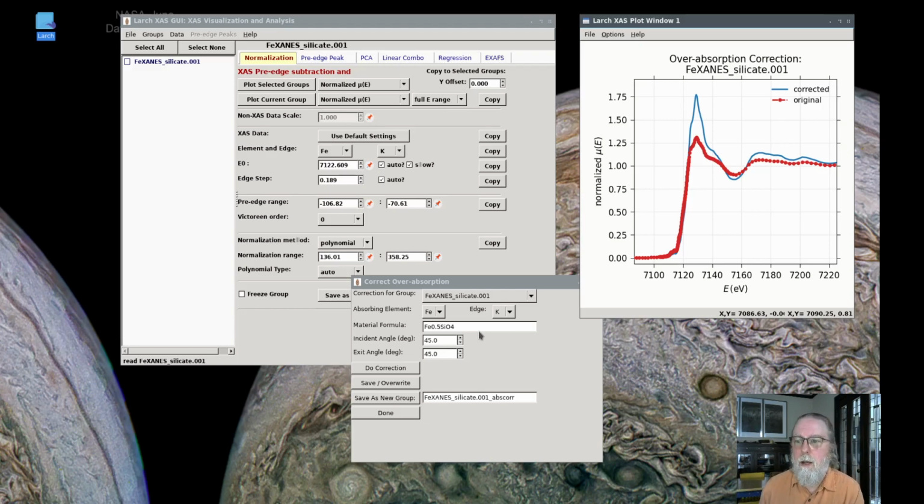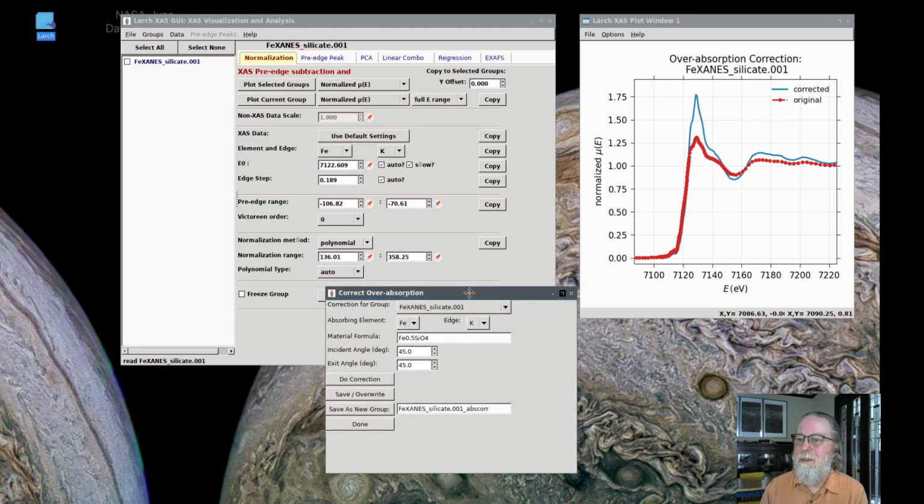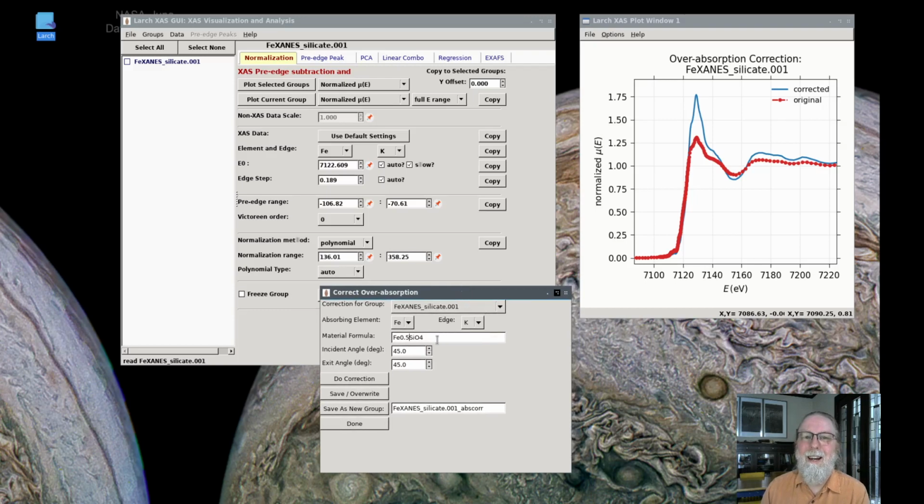For XAFS data, they will give a systematic error in the Debye-Waller factors that you analyze. So if you're doing extended XAFS analysis and want the Debye-Waller factors to be accurate, then you'll need to make sure that these corrections are done. There are actually other algorithms available. If you're interested in having those be readily available within Larch, contact me and we can easily add those, I believe. I may want your assistance in that. But for XANES, this is generally considered the better approach to use.